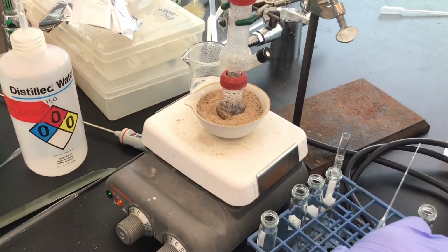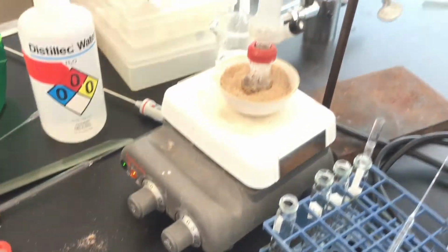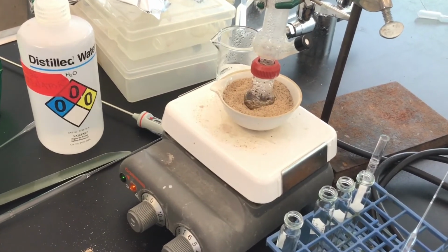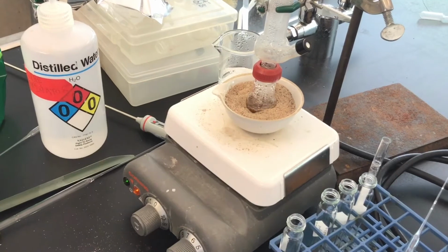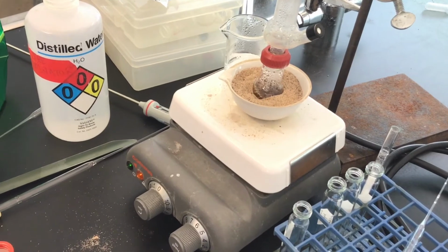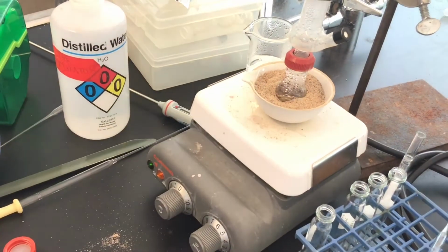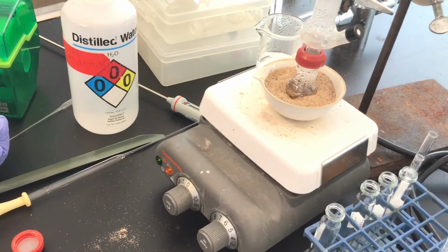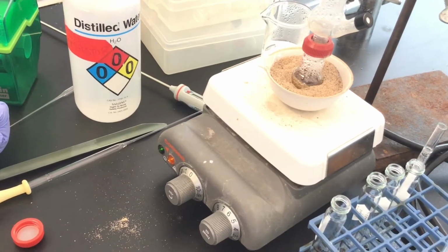for this steam distillation. If you were to do this on a large industrial scale, you would have a fancier setup, obviously, and it would be what is called lighter than water extraction, and you would use a special device. It's a piece of glassware in order to continuously extract out or distill out the organic components, and it's such a specific type of glass that it's a continuous distillation.